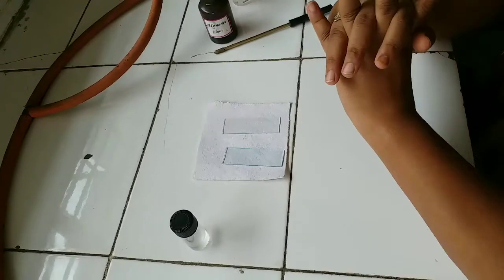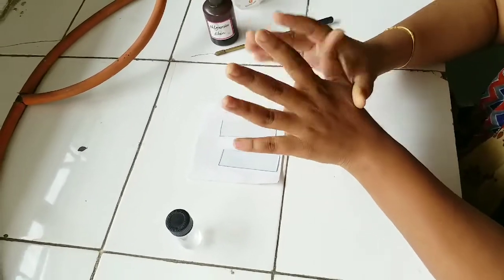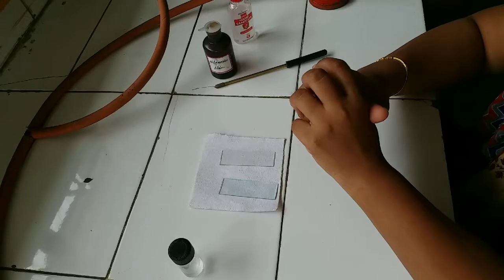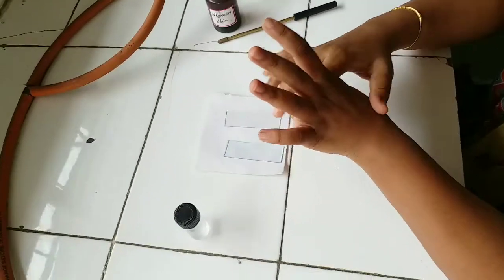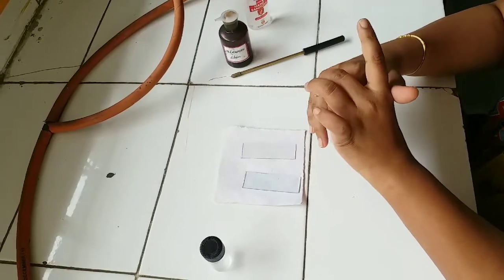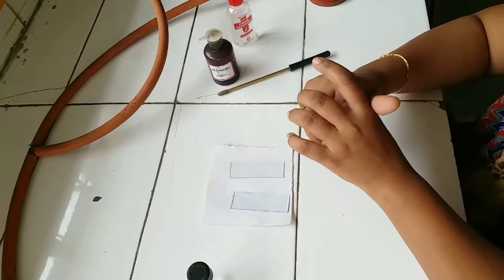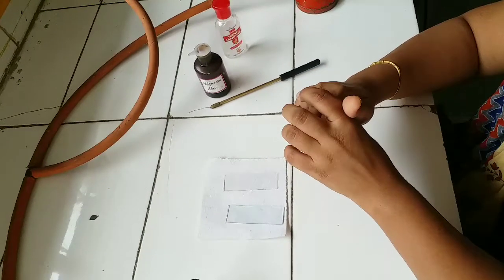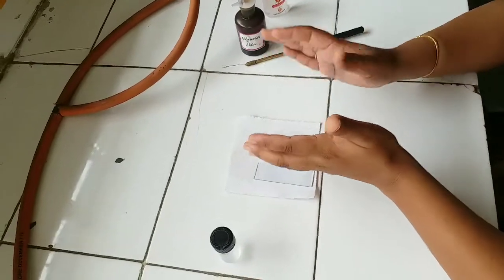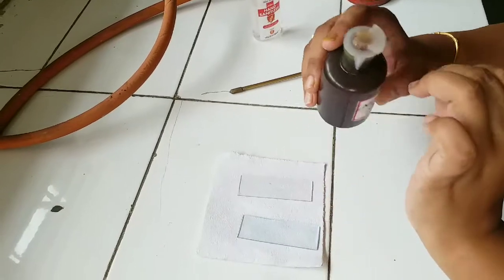Hello students, today we are going to study experiment number 8. The aim of the experiment is to perform negative staining. In our last practical, we performed simple monochrome staining in which we used a basic dye. Today, in negative staining, we are using an acidic dye — nigrosin — which is an example of an acidic dye.